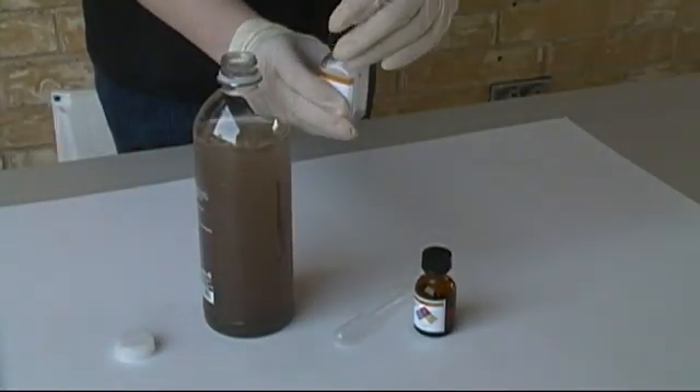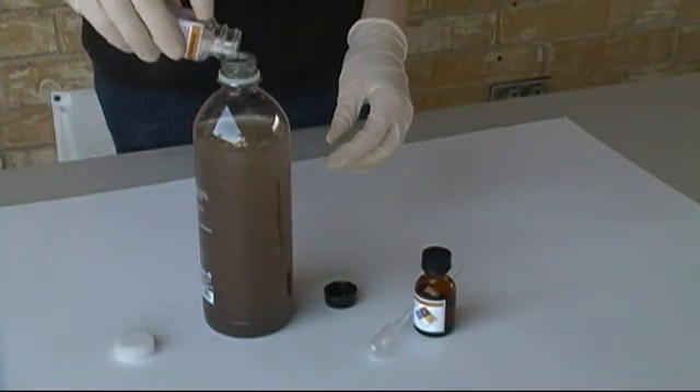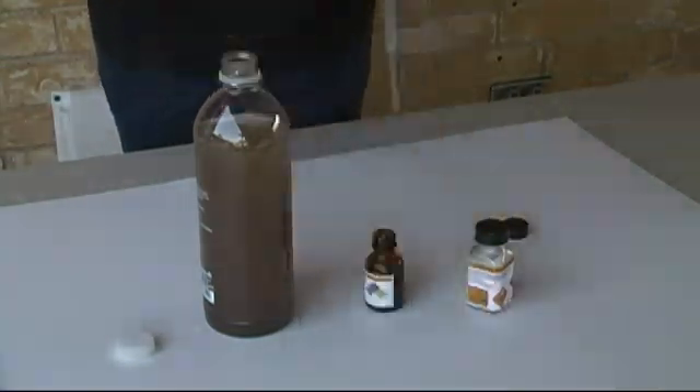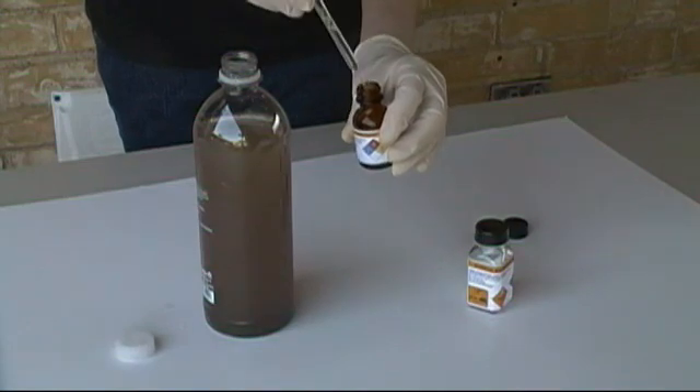Open the other bottle and place a very small amount of sodium hydroxide inside it. A little goes a long way, so no more than a gram. Then open your container of aluminum chlorohydrate, fill the pipette with the solution, and deposit it in the bottle of dirty water.